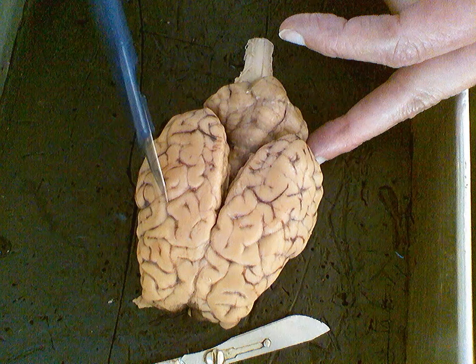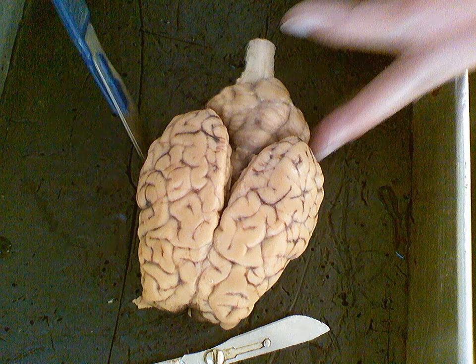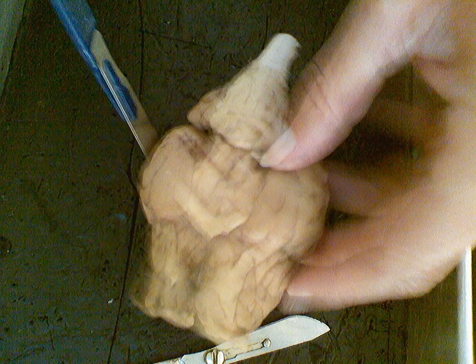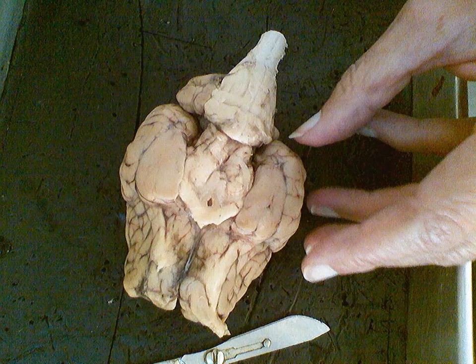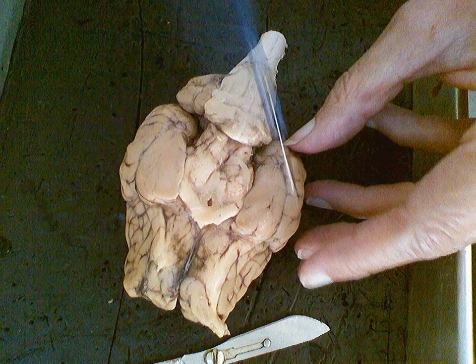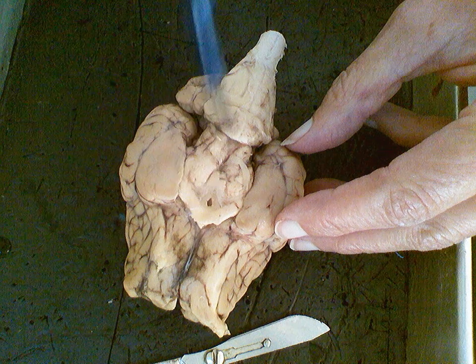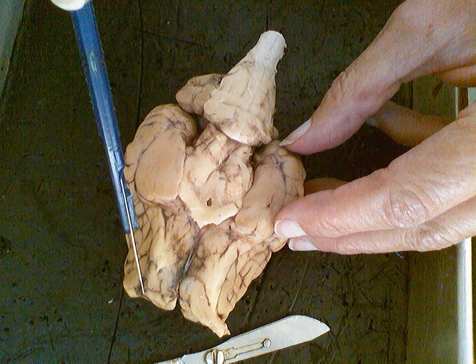We're now going to flip to the basal view. Hopefully this doesn't go out of focus too much. So here we are on the basal side, the basal view of the brain. We can look here, so this is lateral, this is medial, right down the midline. Here's anterior or rostral. Here's posterior or caudal.